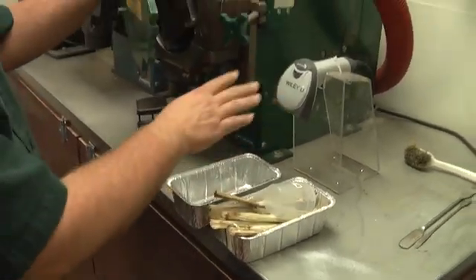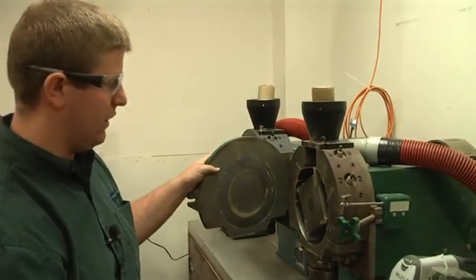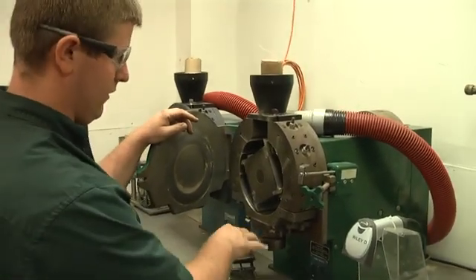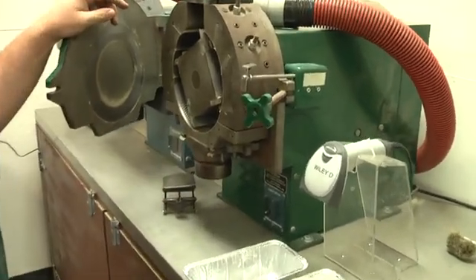Now that our samples are logged into Wiley D, we're going to open up the machine, make sure everything is clean and in working order and ready to go for the on-farm network soybeans or the corn stalks. All corn stalks here at the lab go through a three millimeter screen.